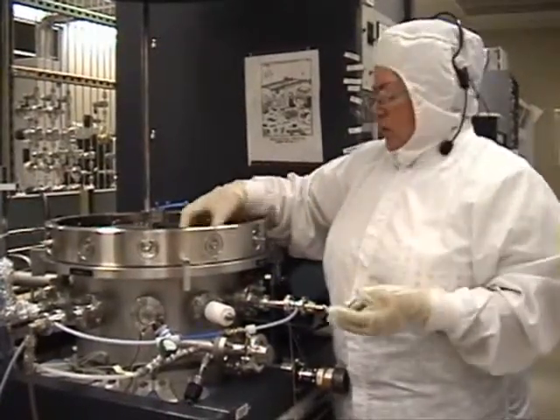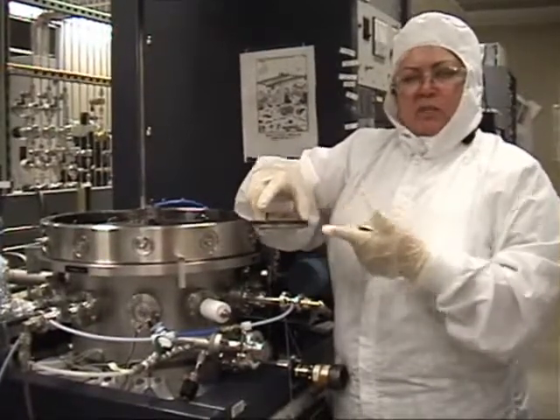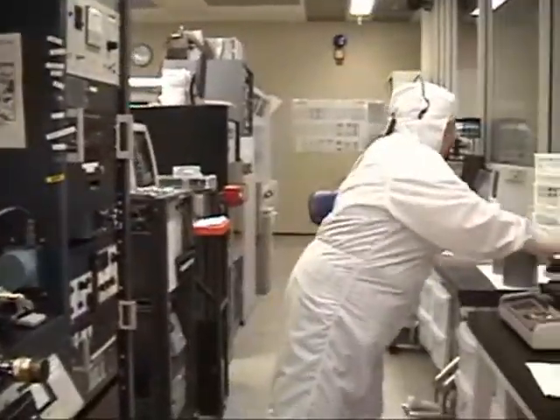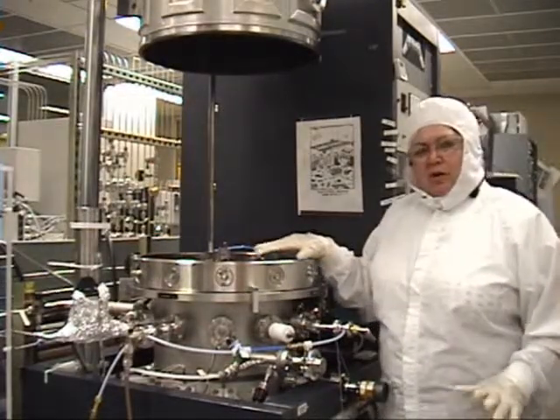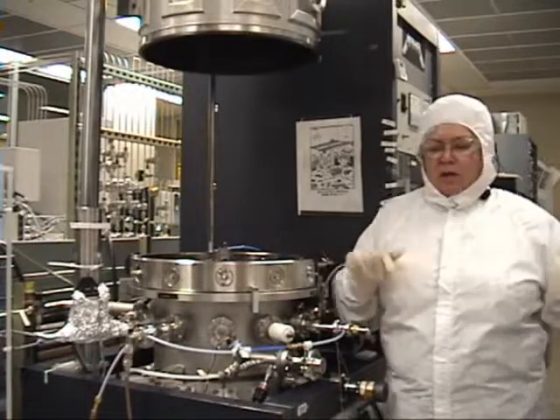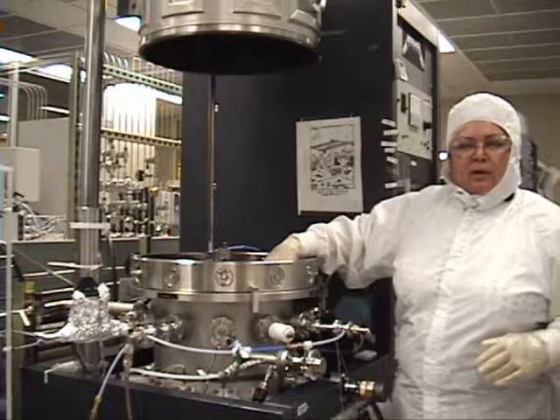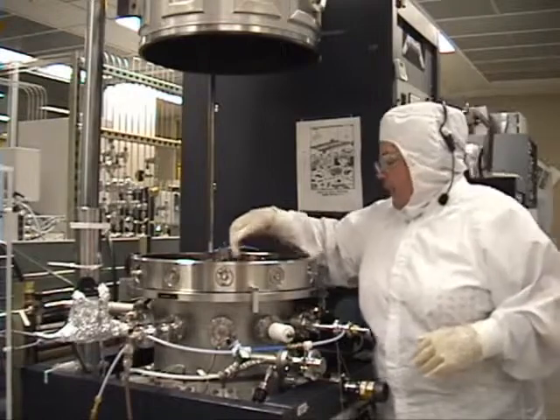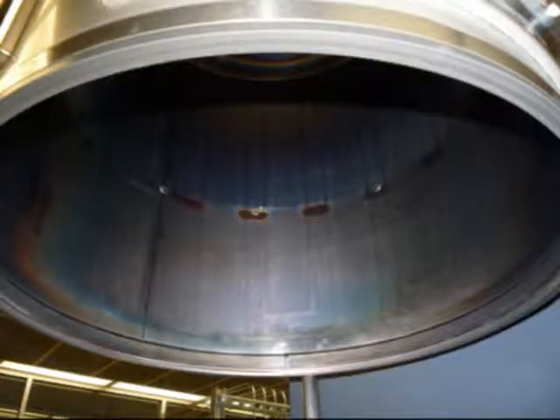You have your cathode, you have your anode. You have to hold the anode from the center because it's two pieces — if you try to hold it at the edge, it will fall on the floor. Once we've removed all the parts and set them on the clean wipe, we're going to do an inspection to make sure that the previous users have cleaned off the magnetic cable, and to make sure there's no broken wafers, and that no one has sputtered any metal on in the bell jar.